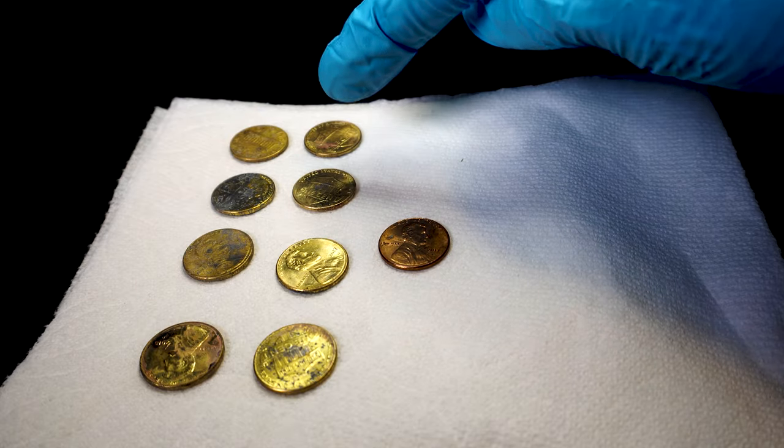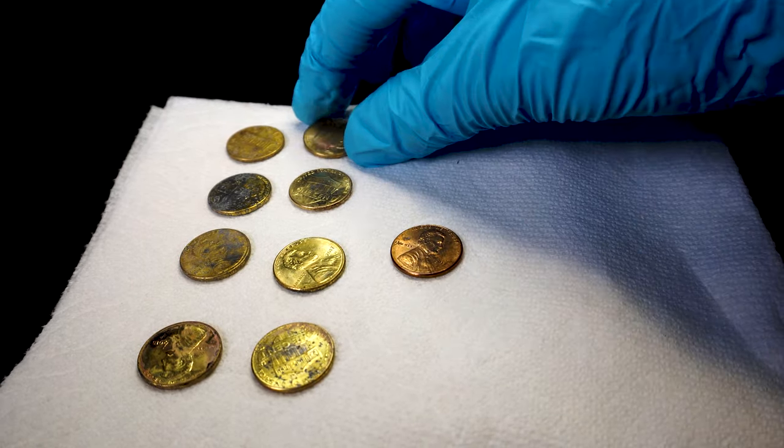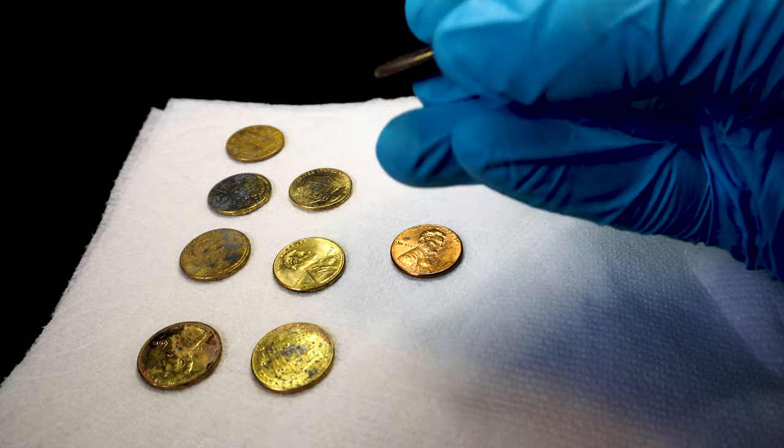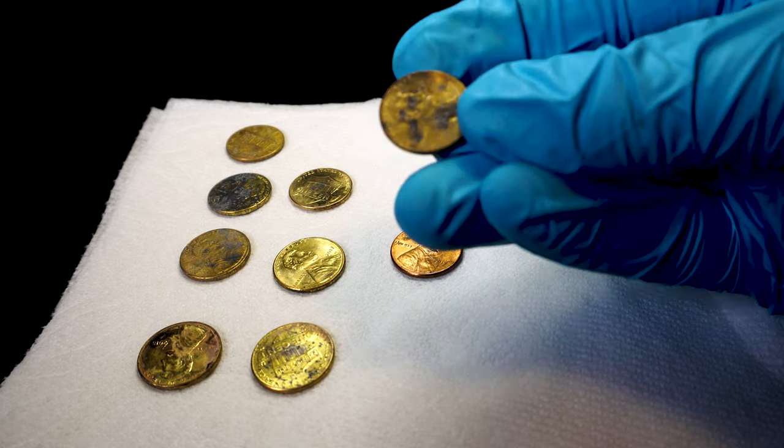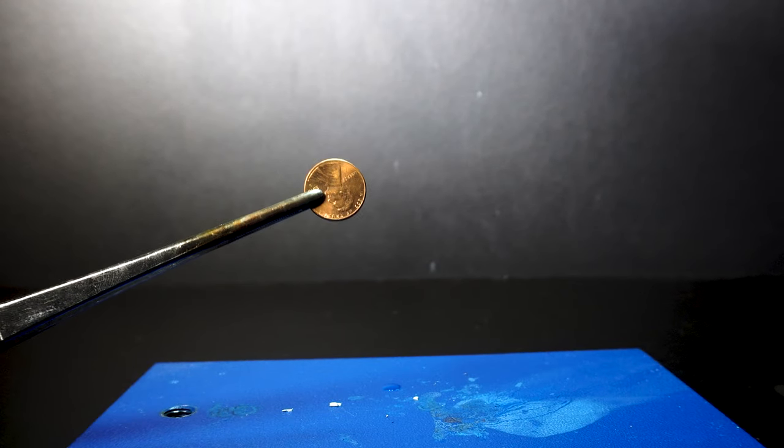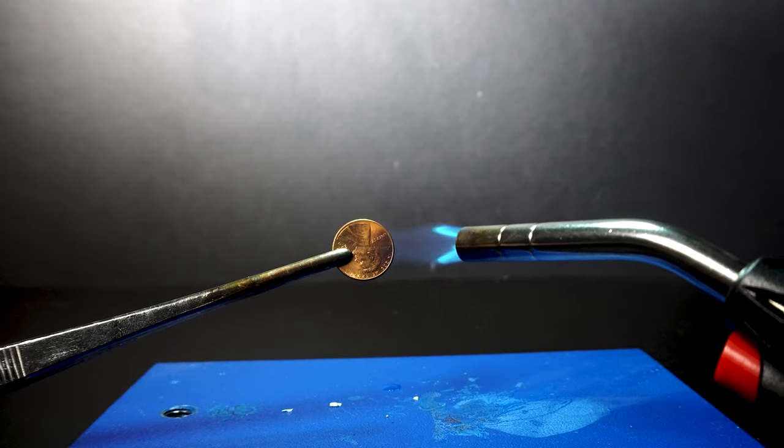As I said before I made some pretty basic mistakes. So I decided to do everything one more time however this time I will not use older zinc oxide pieces and instead I will use zinc from the inside of a penny. This zinc has been safely protected by a copper layer and it is far shinier and overall a better quality.